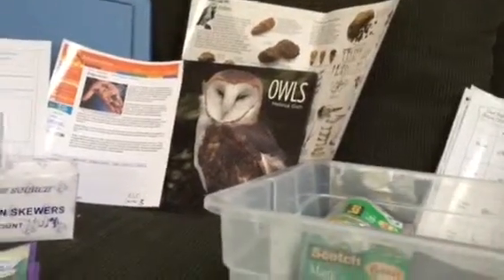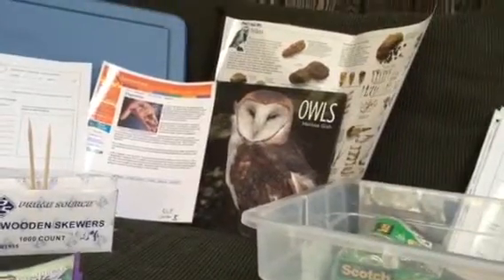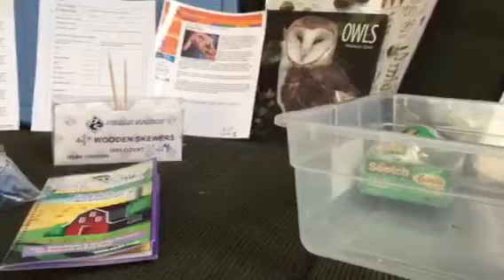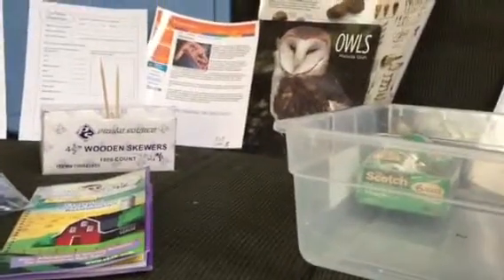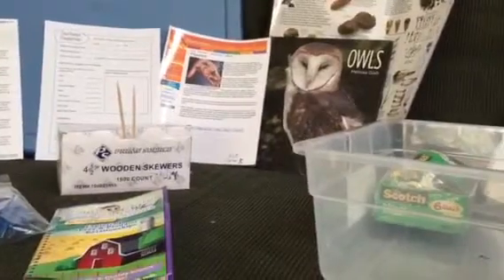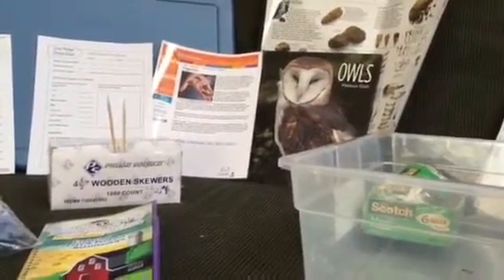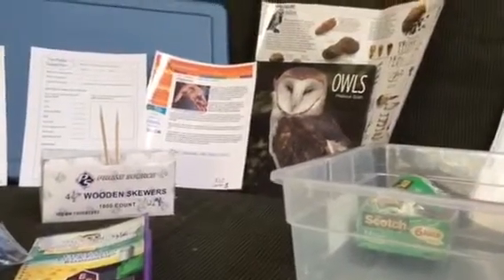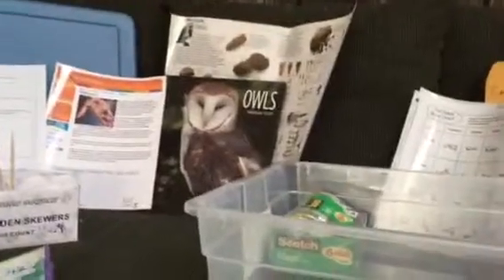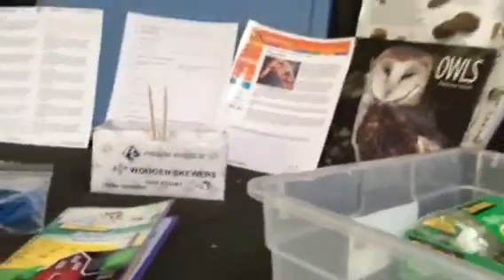So when everyone's finished at the table, you could decide to compare the contents of the different pellets within the students at the tables. There are some owl pellets we mixed up. There's a mixture of larger owl pellets that might have bigger animals in them, bigger skulls, with smaller ones, so it'd be good for the kids to share. Try to mix those up as you pass them out, so each group gets at least one big one, and then they can compare those. And just have a discussion about what the kids have learned and they can share.